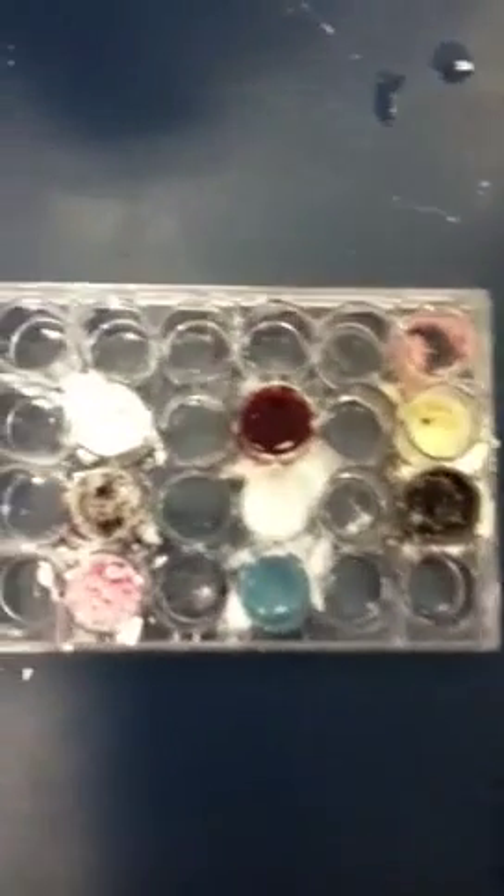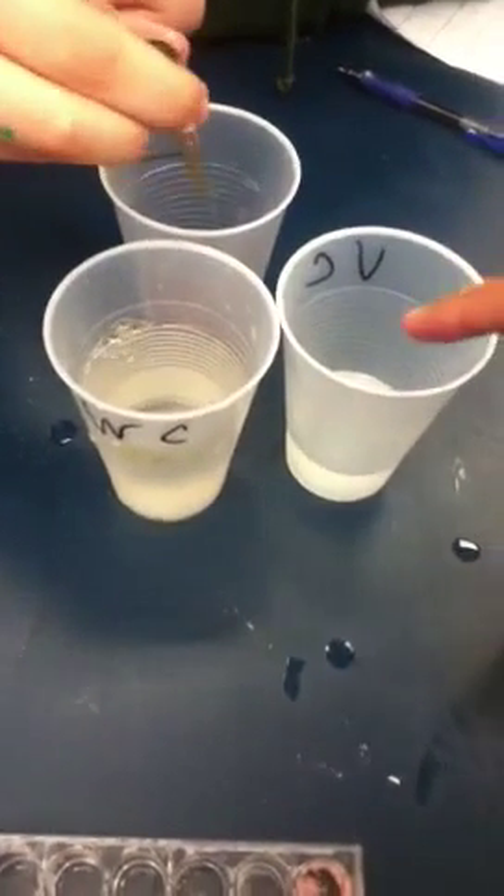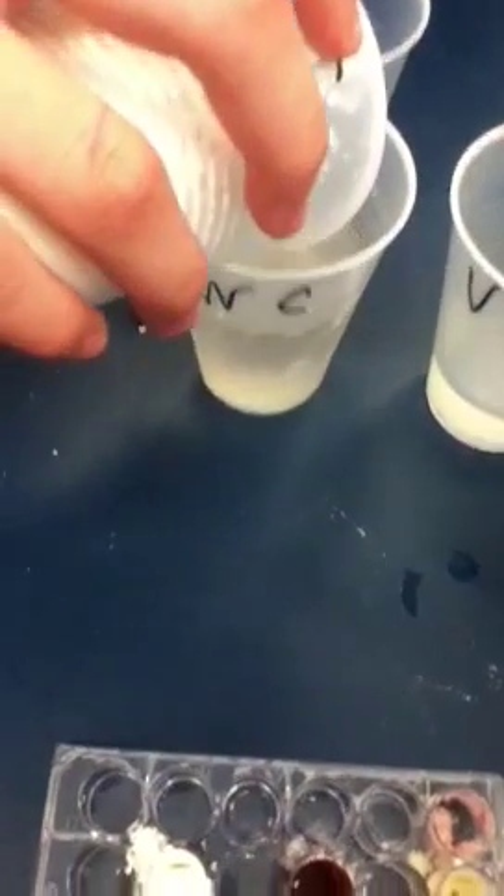Put this. And now we do vinegar. Put this in the right spoon. That's water. Clean it out. That's right. We just gotta pour in the vinegar. What the heck are you doing? Look at what the vinegar did. It's so warm. It's just water. Oh, sorry — I didn't realize I took it from you. How did it become pink with vinegar? That's so weird. Purple. It's like cloudy now. Minus.